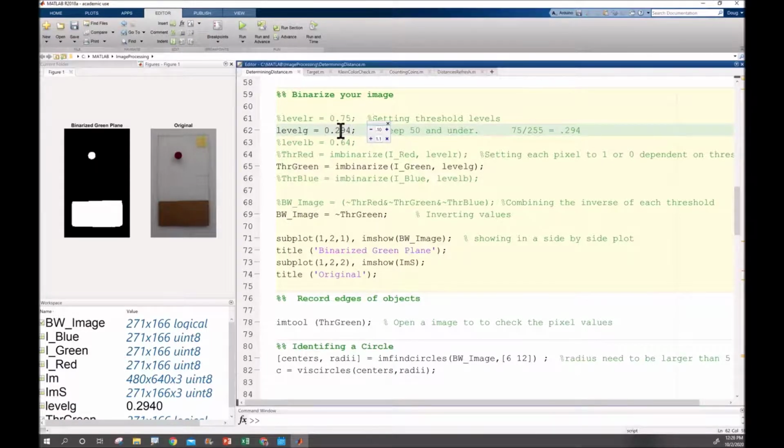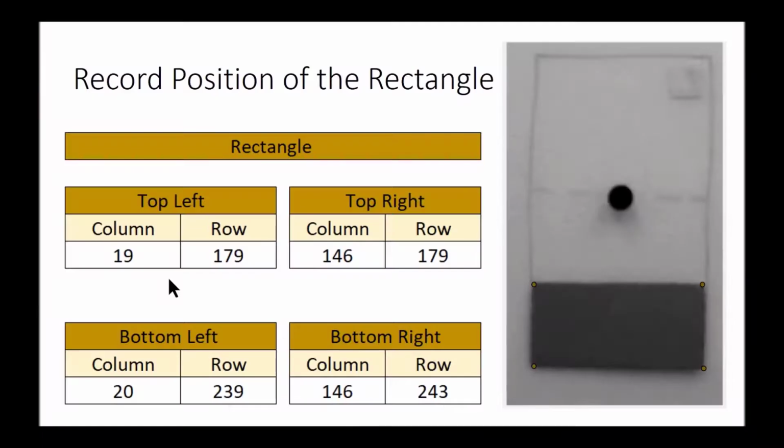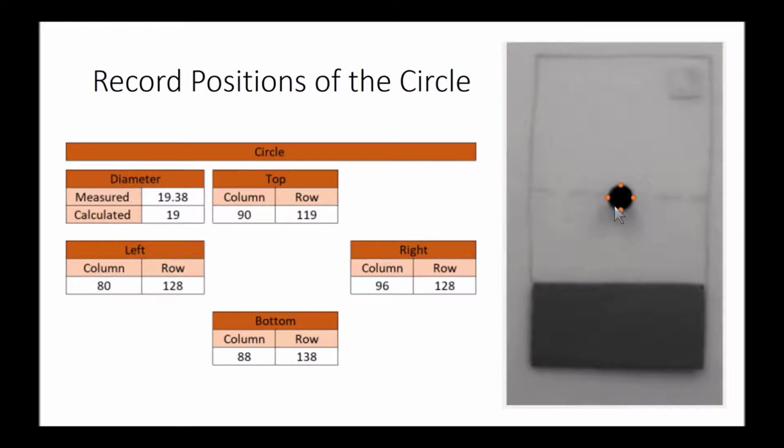I can also go through and increment the values. I've got it set here to 0.1, and I can slowly lift it up and see that my image is changing, and slowly go down and try to get as clean an image as I possibly can. Once that image is in place, I need to make sure I have recorded positions for where I believe my box is going to be in the image, and also the circle. So I'm just getting the quadrants for it and recording it down along with my diameter so I can be knowledgeable about what I'm looking for.